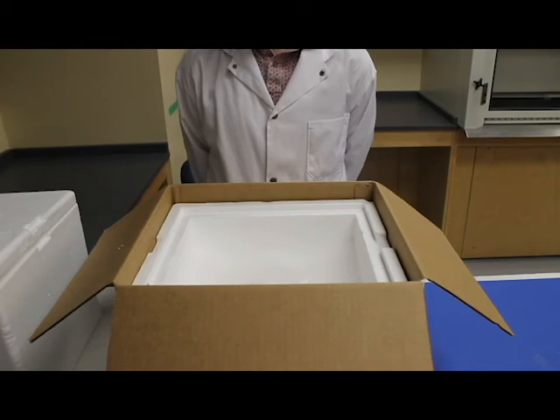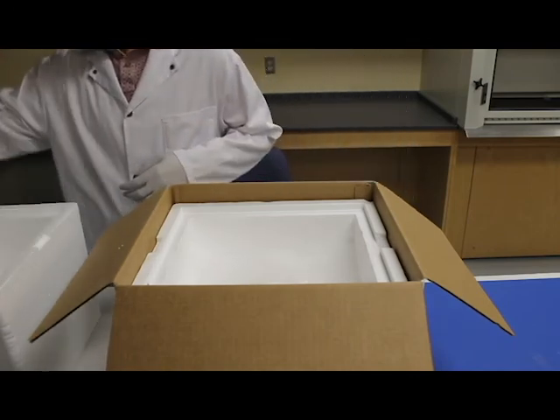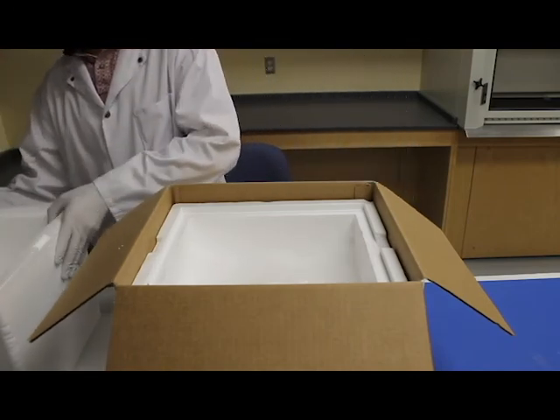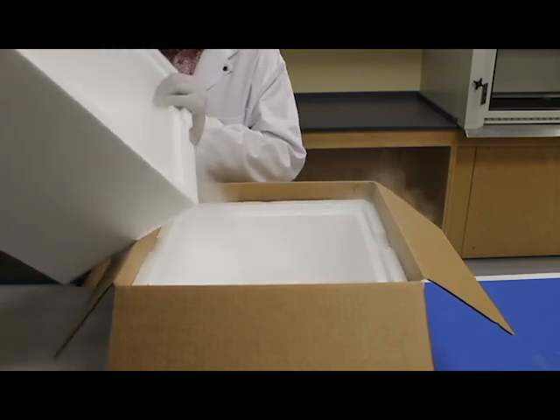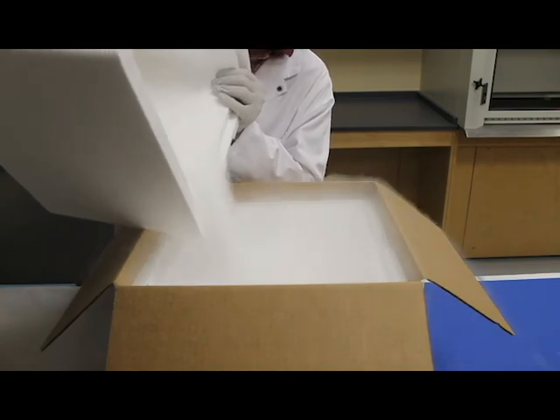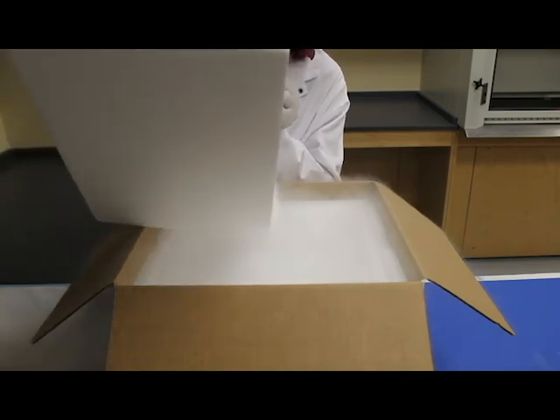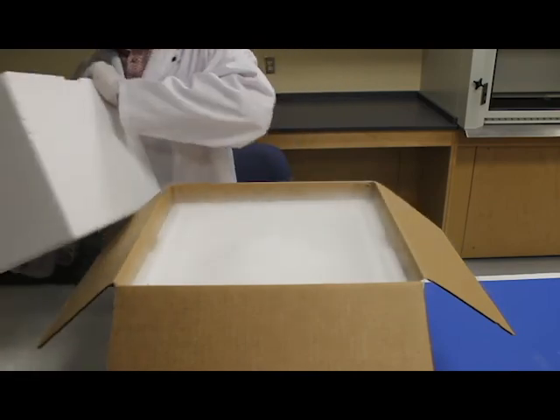Once both biopsy samples have been processed, you can prepare the shipment. Top up the shipping container with approximately 12kg of dry ice. This amount of dry ice should last 3 days while shipping. The sample must be in the middle of the dry ice to ensure that it remains covered when the dry ice begins to sublimate during shipping.